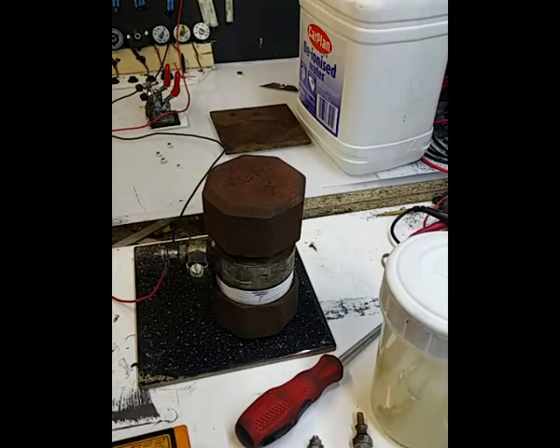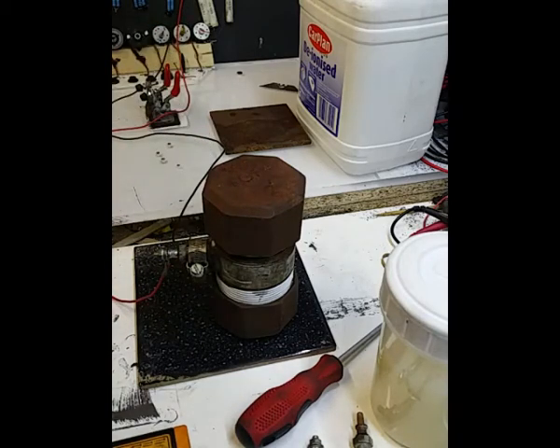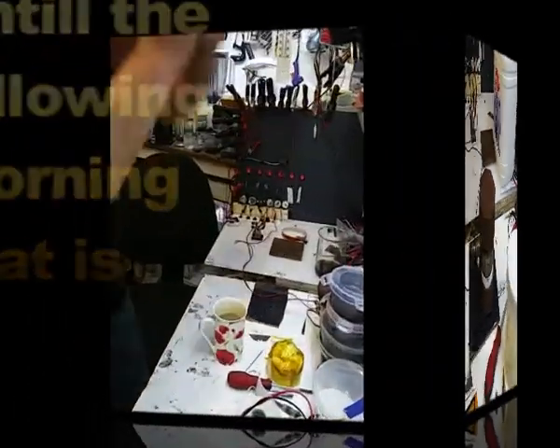So I'm just going to leave that, even though I've got a slight leak and all the rest of it. I'm going to leave it and see what happens. Unfortunately, I've got nothing to put around it as a thermal blanket, at least.